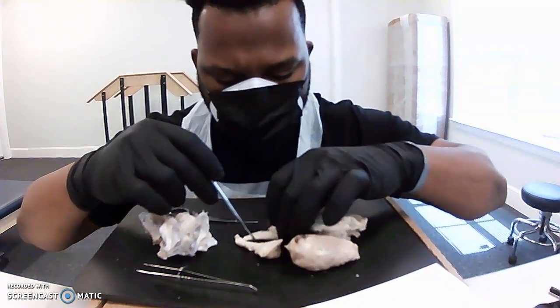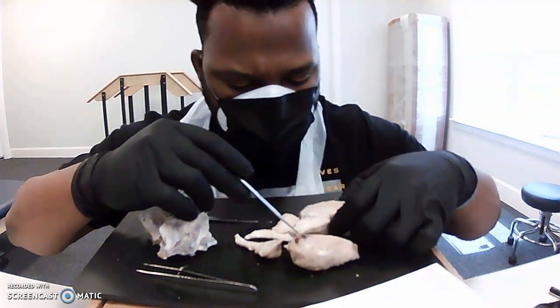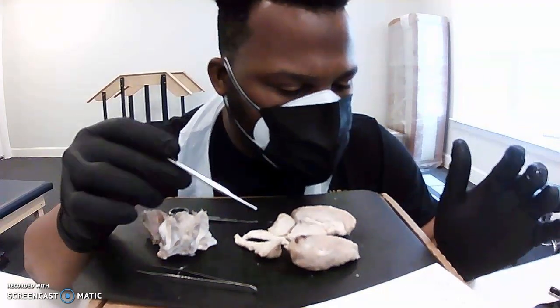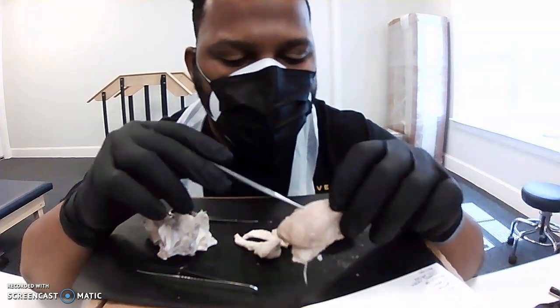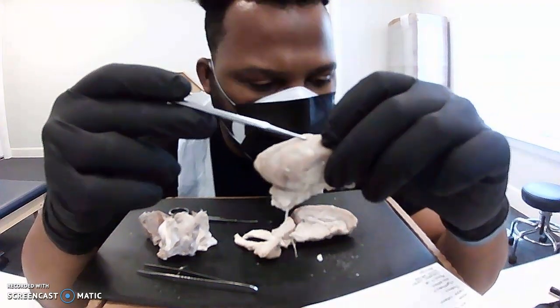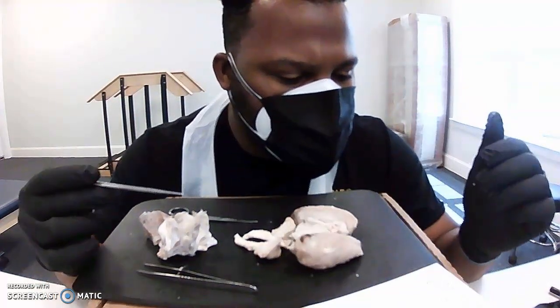The medulla oblongata is going to be this sort of longer piece. Let's say the pons is up here, but you can't really see. Don't need to mention that anyways. Cerebral cortex, meninges. Oh, so on the surface you have these ridges called gyri, and then the grooves are sulcus or sulci. And I think that's all the pieces of the brain.